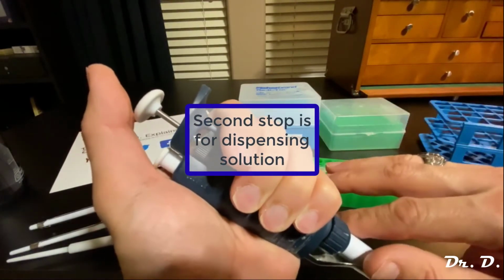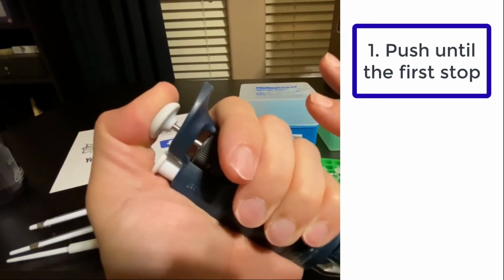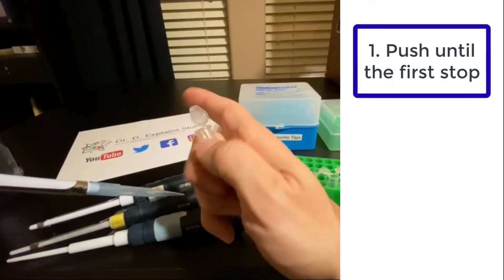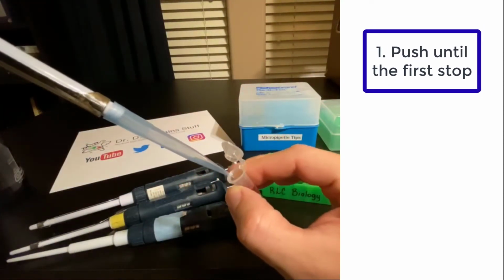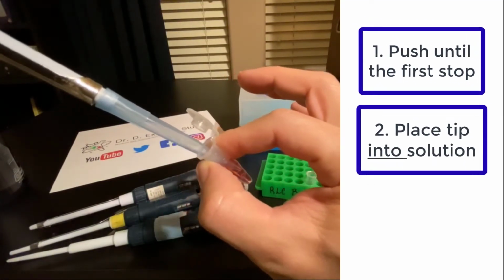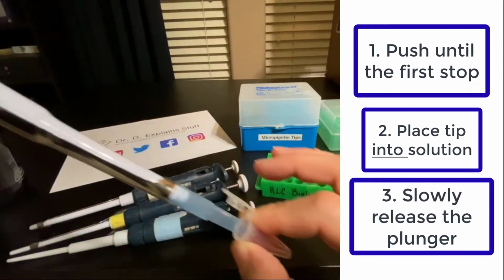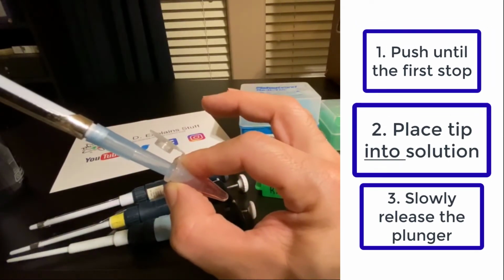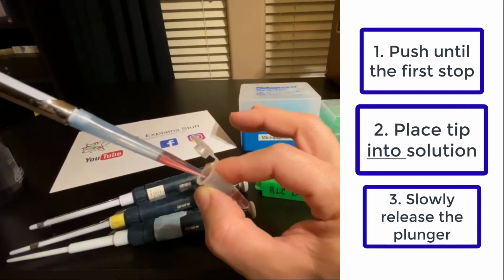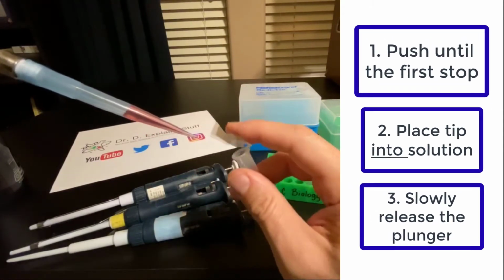So let me show you what to do properly. I'm pushing till it stops. Push till it stops. Open up your container with a satisfying pop. Put the tip into the solution. Make sure you actually see the tip in the solution. Then very slowly release your thumb. Don't just release it really quick. Slowly release your thumb, and look what happens. Great. Look at that. No air bubbles in there. Looks perfect, doesn't it? So close that up.